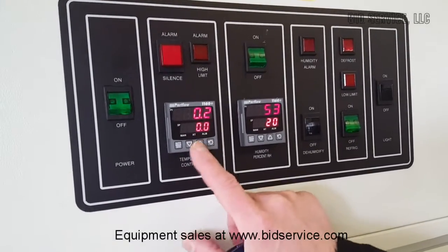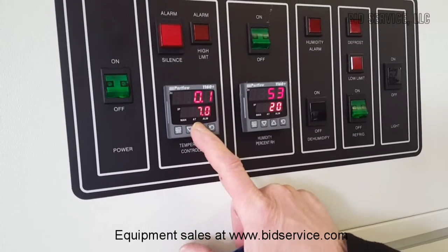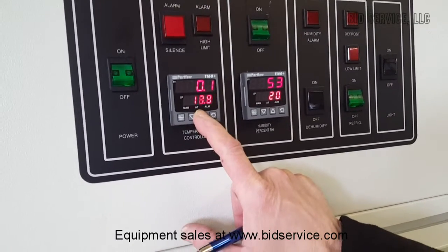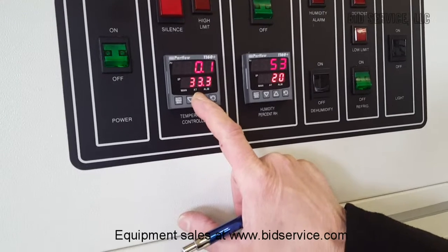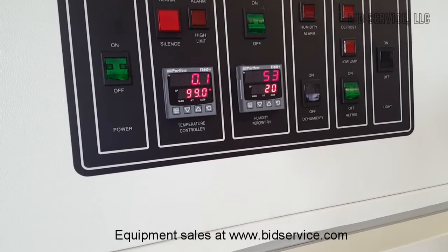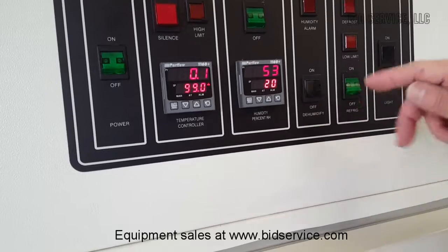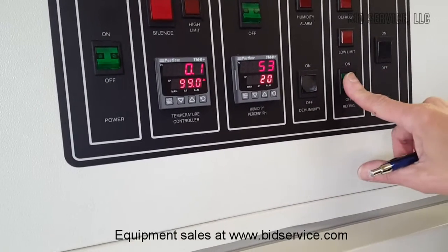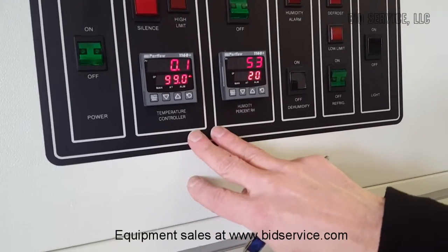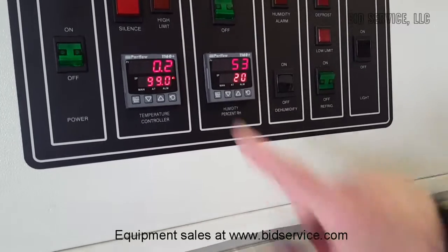So what we'll do is we'll bring this temperature up just by pressing the upper arrow. We'll bring it up to the maximum range and we'll allow it to heat up — we'll go to 99. At this point I'll shut the refrigerator off; it'll heat up a lot quicker that way, not fighting against the refrigeration system. So we'll allow this to heat up and show that the range of 0 to 99 is possible, then we'll go ahead and start setting some humidity levels.